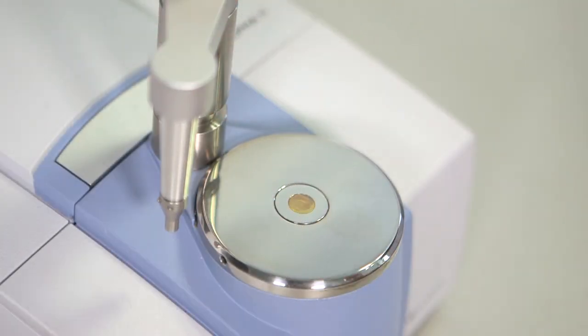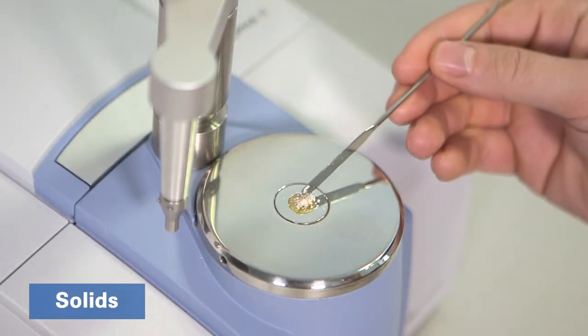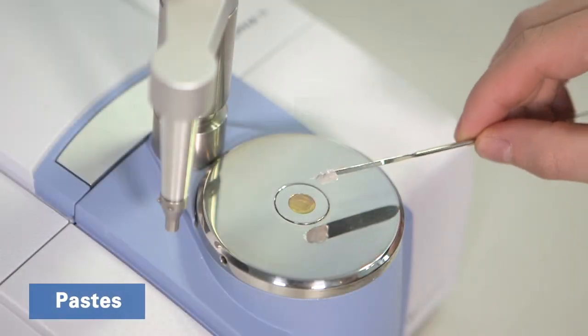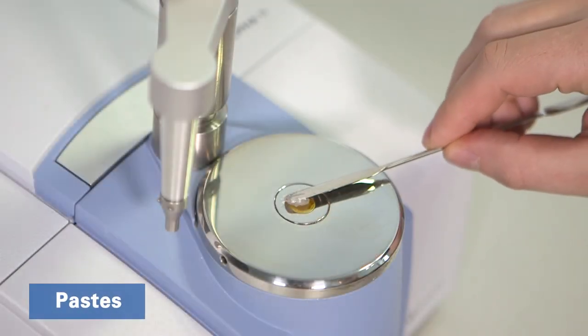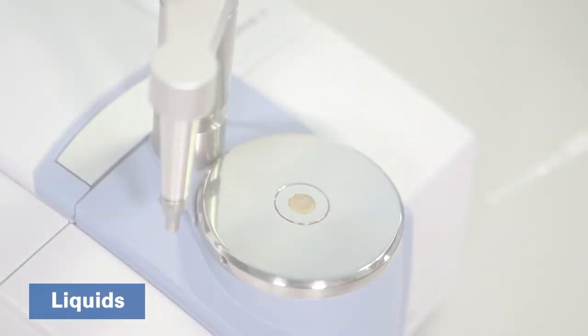Analyze any solid, like powders, pellets, or finished products. ATR is also suitable to investigate pastes, oils, and other liquids.